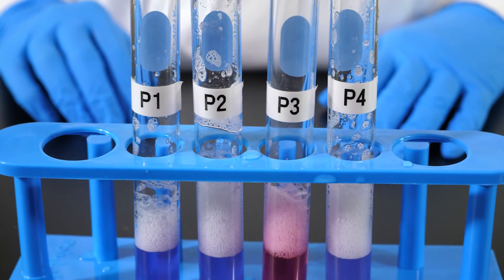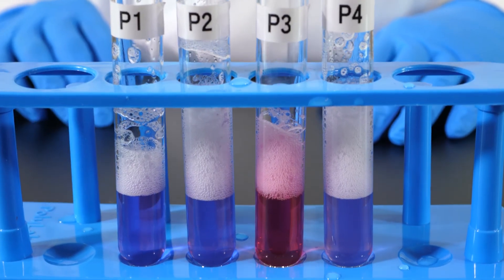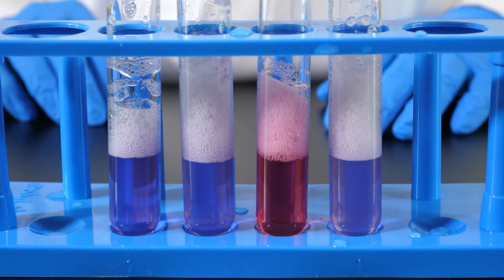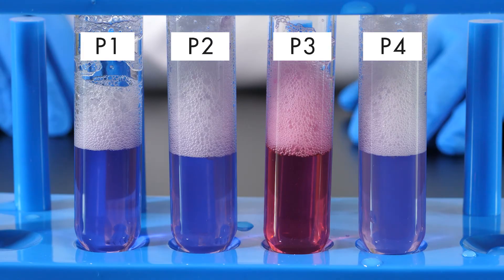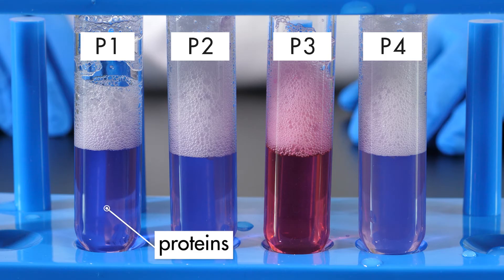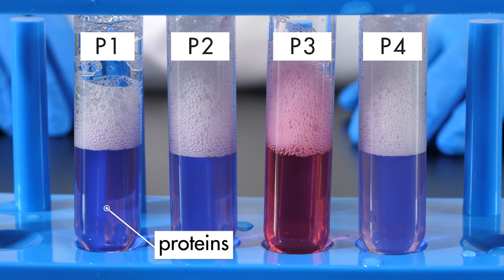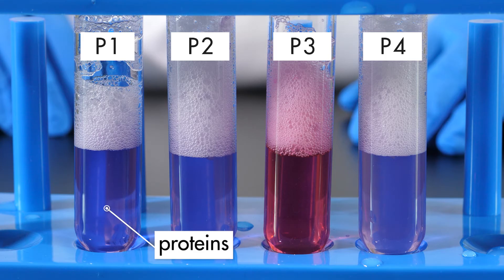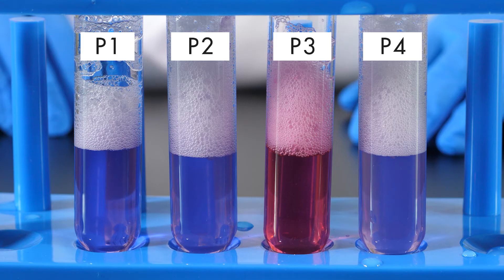Let's check test tube P1, which contains albumin and the pepsin solution. The solution turned purple, which means proteins are present in the solution. So protein digestion did not take place. This indicates that pepsin alone is not sufficient to digest proteins.